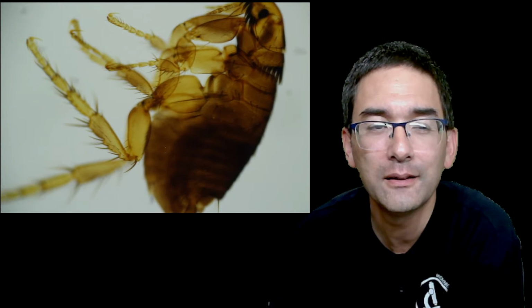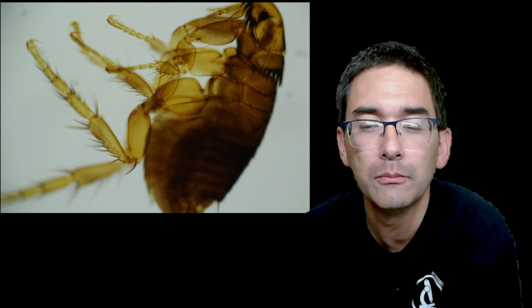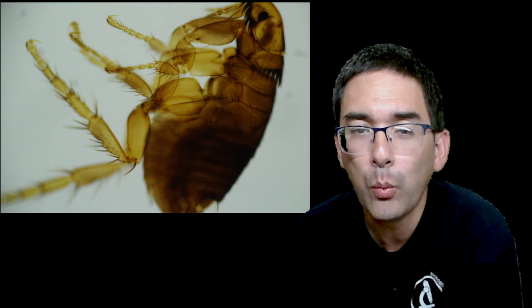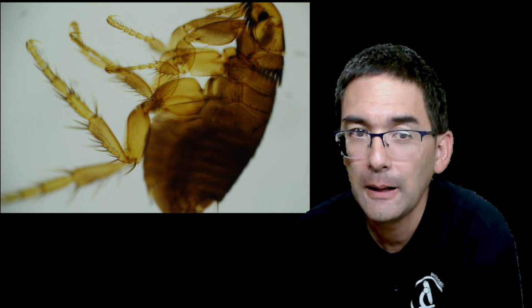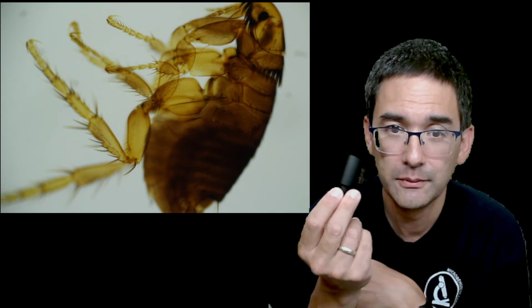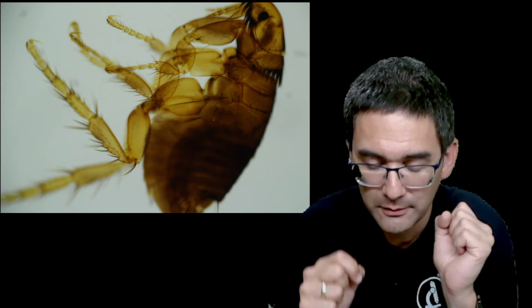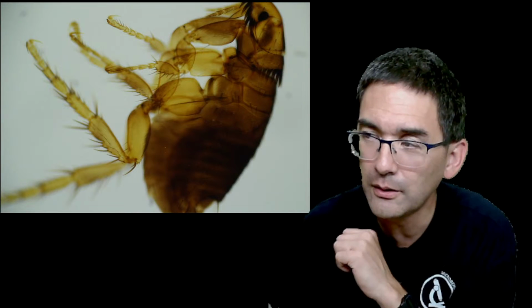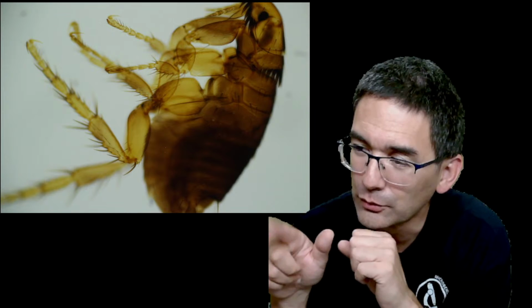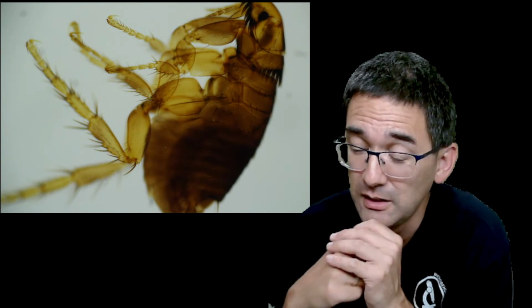And you can see that the flea, this is a 10 times objective, is pretty much visible in completeness. So I'm getting a very wide field of view. When I use, for example, this camera over here, the small one, then I'm only able to get a very small part of the flea imaged. Even the other camera with the reduction optics is only able to get a part of the flea. So this direct projection over here is actually, I think, a pretty decent system and decent solution.